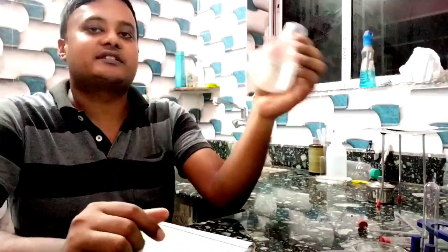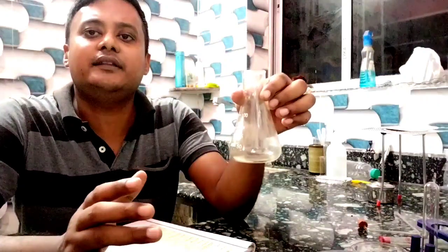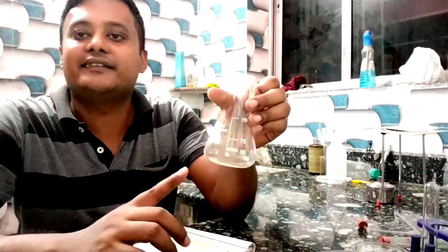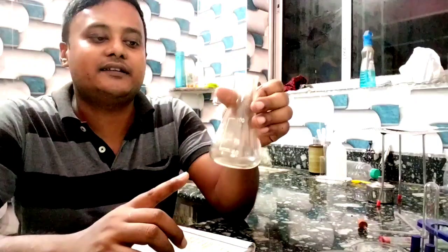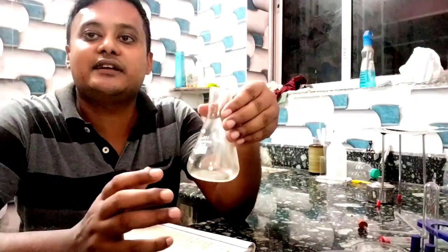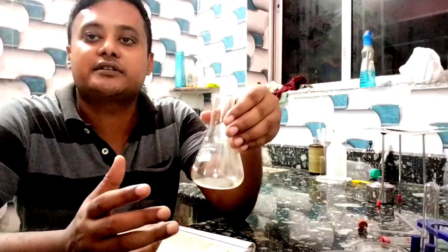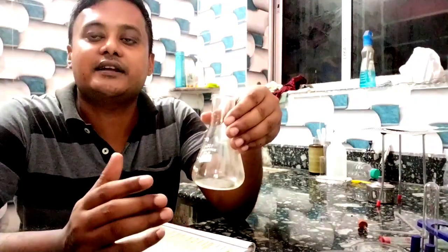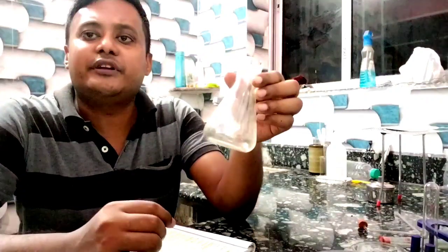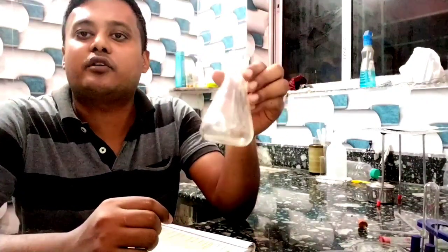Next one: conical flask. It is also available in different volumes — I have a 100 ml flat-bottom conical flask. There is also a round-bottom conical flask, which we use for heating purposes as it allows uniform heating. The flat-bottom conical flask is used during titration.